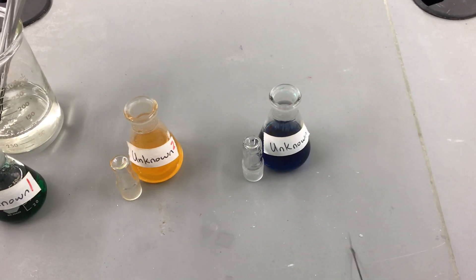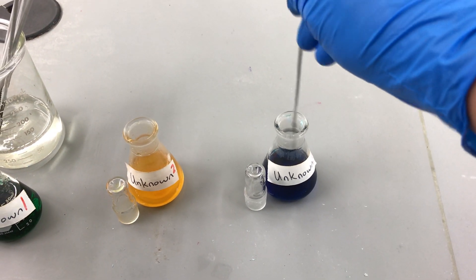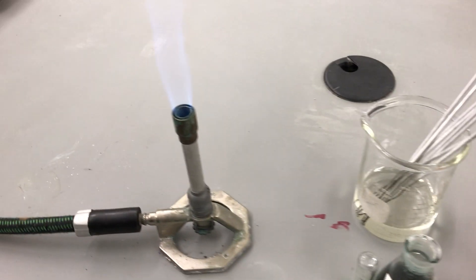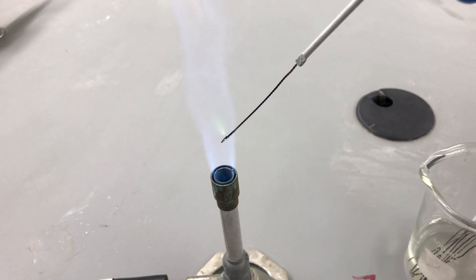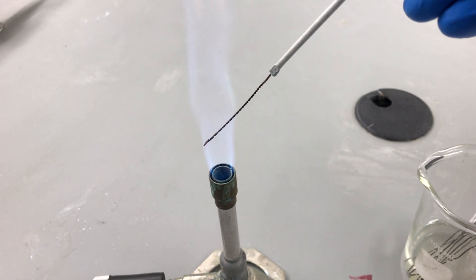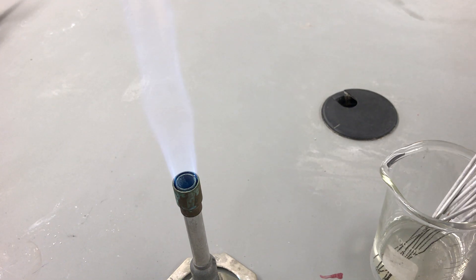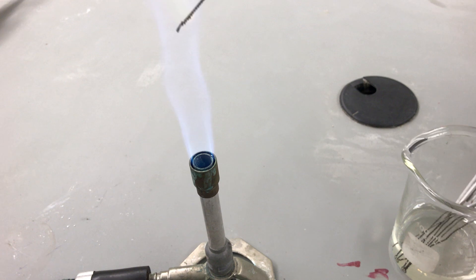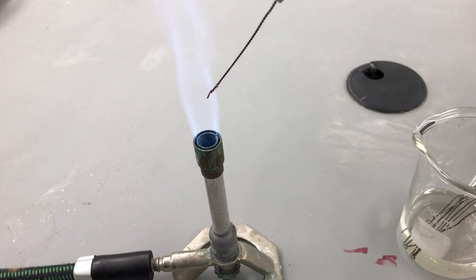Finally we have unknown three. We're recording this data on table two. Introducing unknown three to the flame — and here we see a very, very distinctive bright green color. Beautiful bright green color for unknown three.